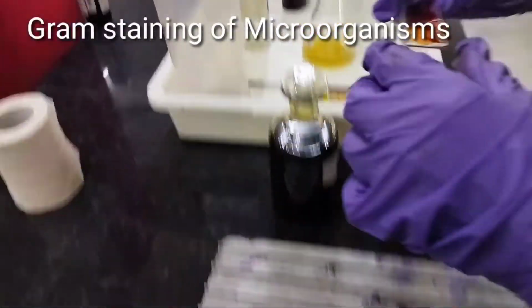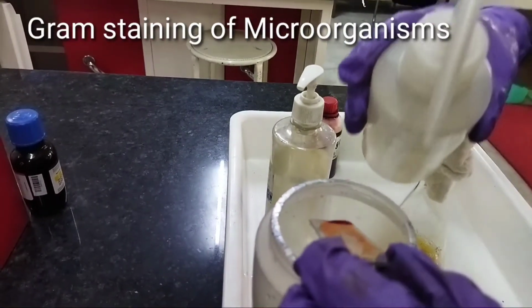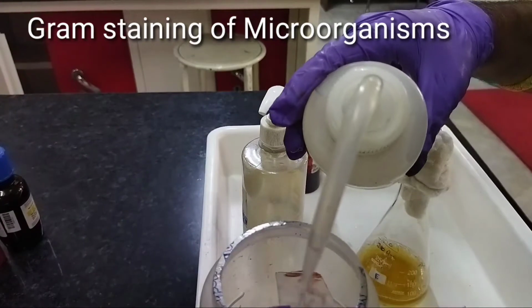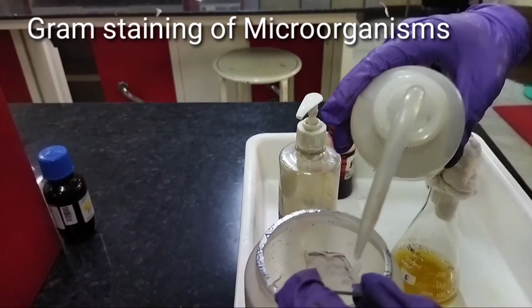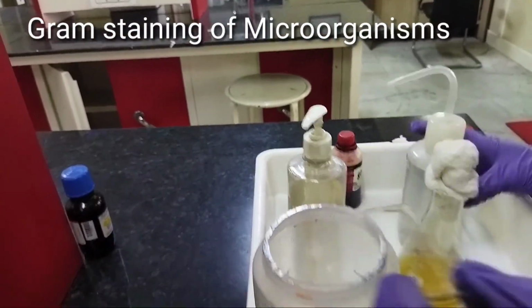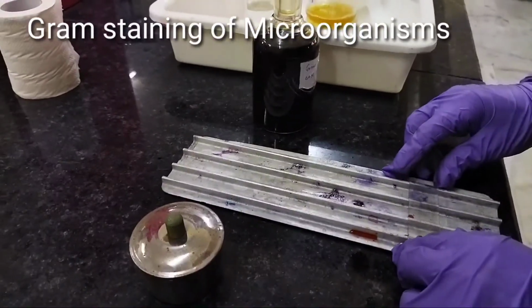Now we will again wash the slide with distilled water with a gentle flow like this. Now our slide is prepared.